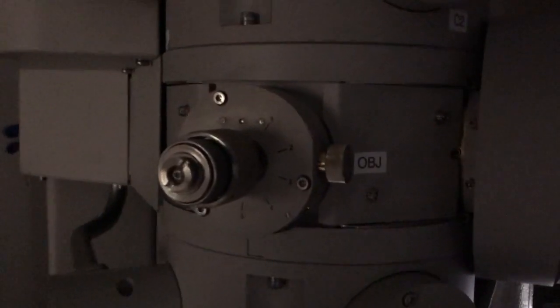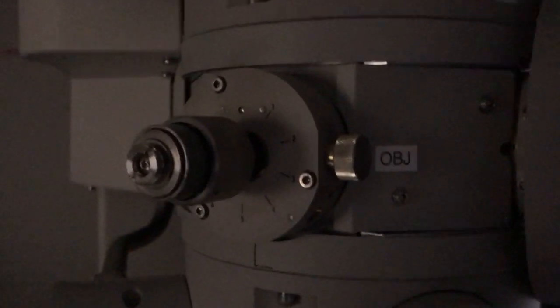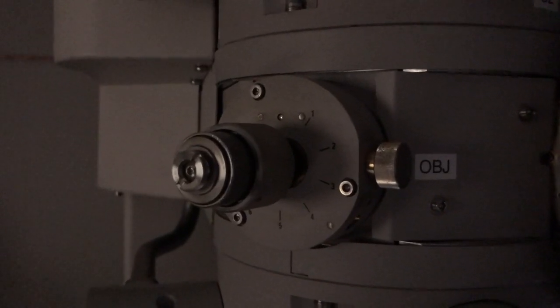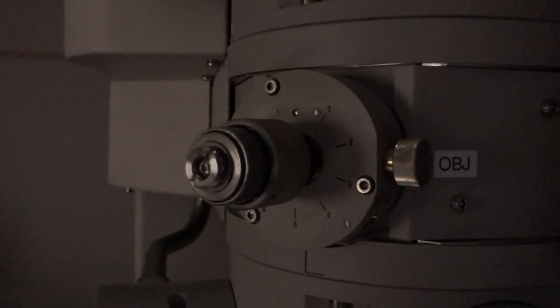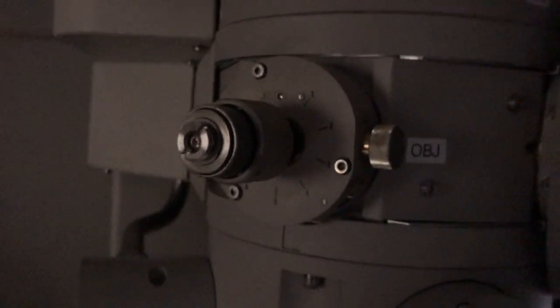And for our purposes, when you're doing this, you usually want to use the smallest objective aperture that you have. So if I come up here to my objective aperture strip, okay, so again, 4 through 1 are actual apertures. 4 is the smallest, and 4 is the one that we use whenever we're doing bright field or general 2-beam imaging, because we can only select, or want to select, a single beam.